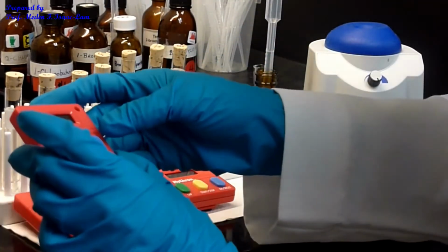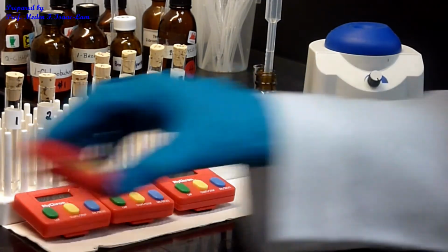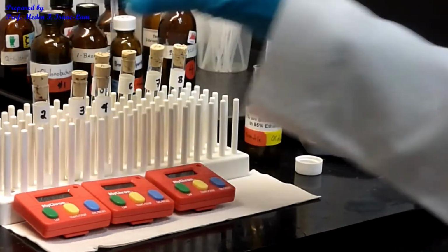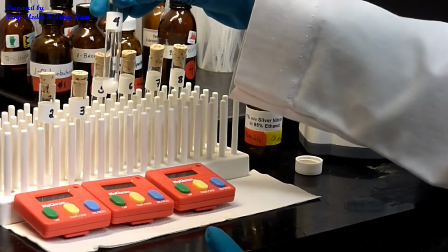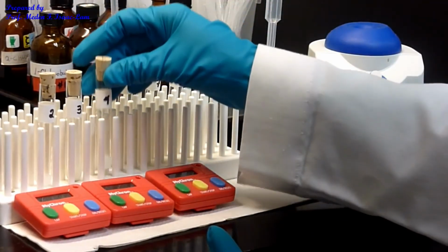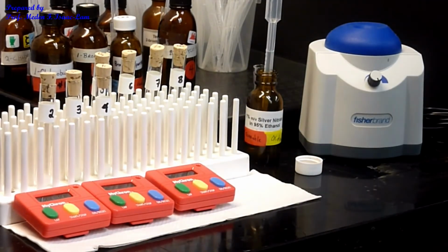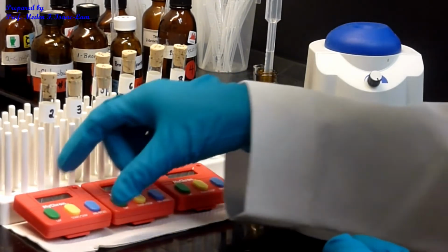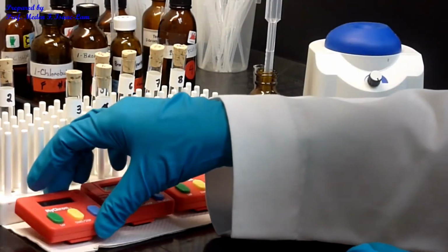So this is done, but we'll let it go. All right, and put it here. So I put it at the back, and this is almost done here. So again, 3 is the most out of 1, 2, 3, 4, and then followed by 4, and then 2, and then 1 is the least for now. So this is almost done, 4.55 minutes. Okay, so put it at the back.